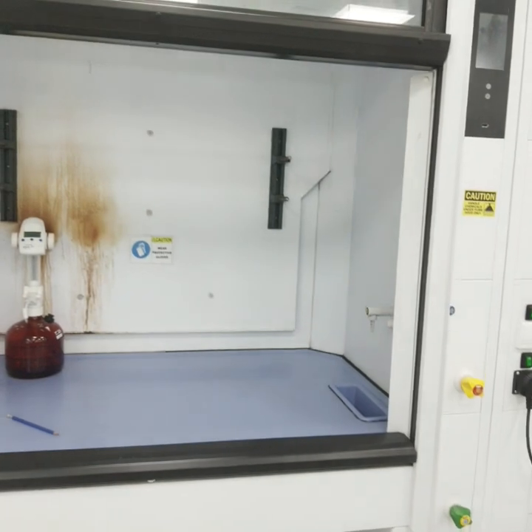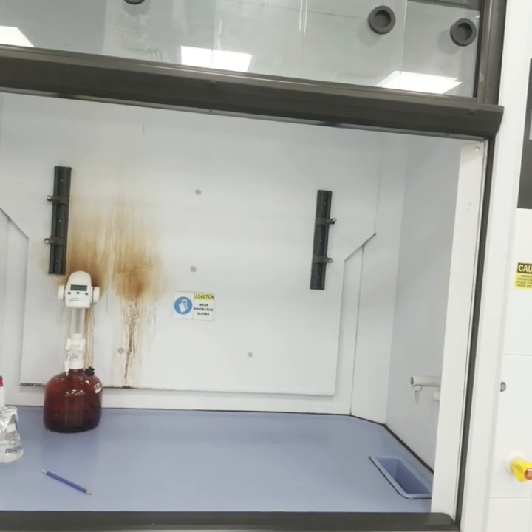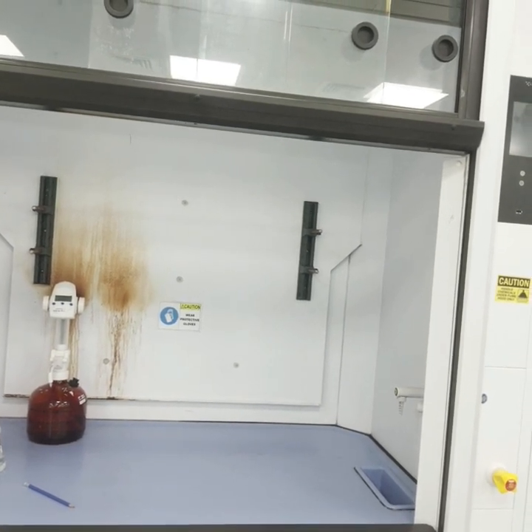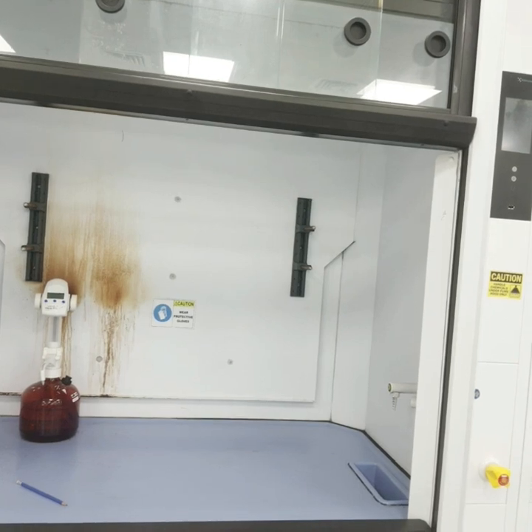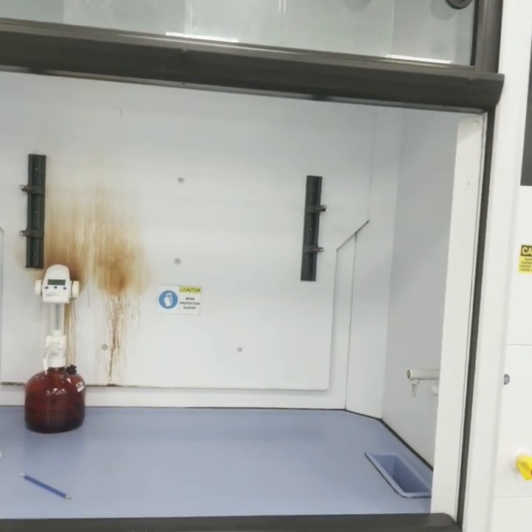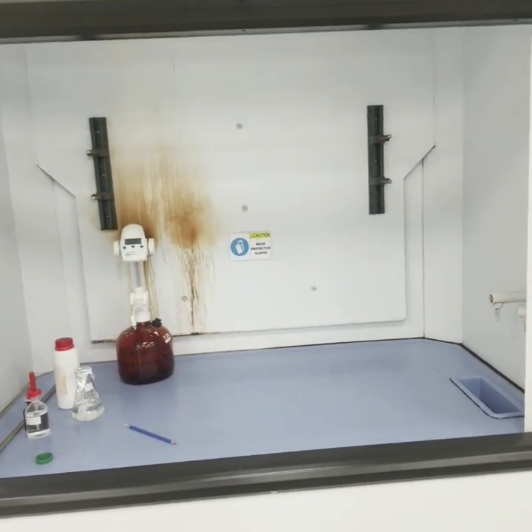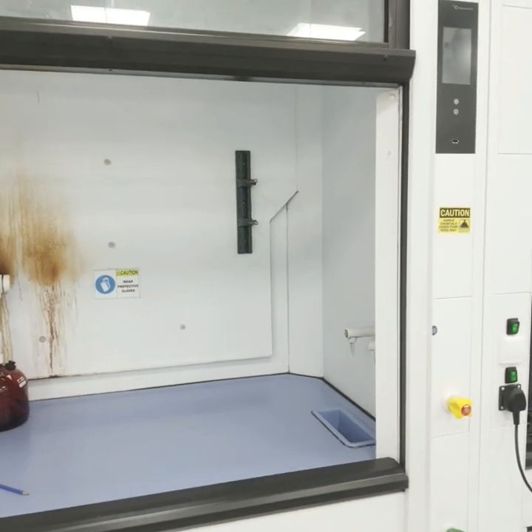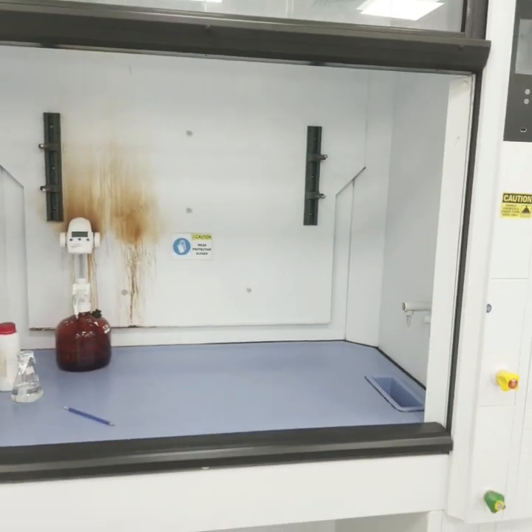HEPA is an acronym for High Efficiency Particulate Air filter, officially defined by the US Department of Energy. This type of filter can theoretically remove at least 99.97% — essentially 100% — of dust, pollen, mold, bacteria, and any airborne particles with a size of 0.3 microns or larger.